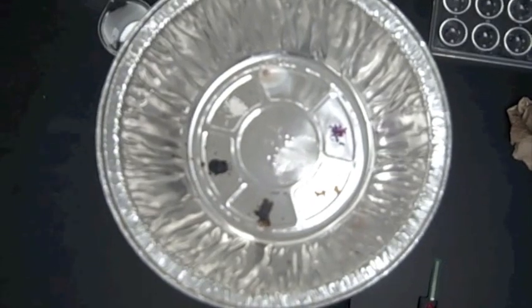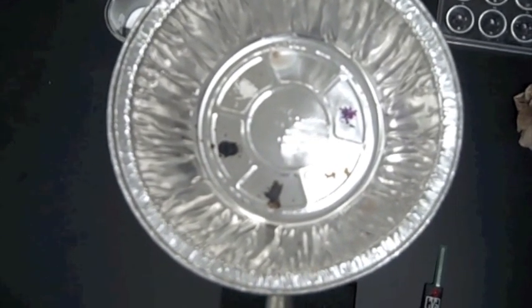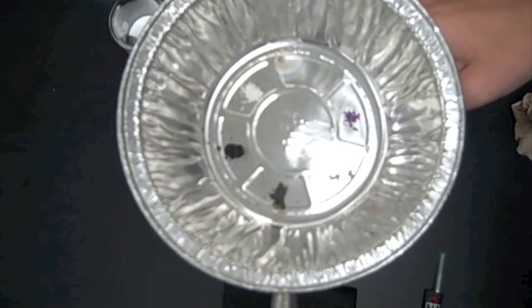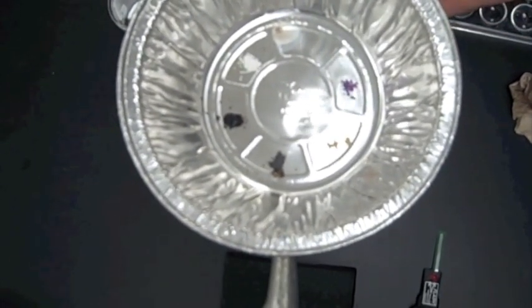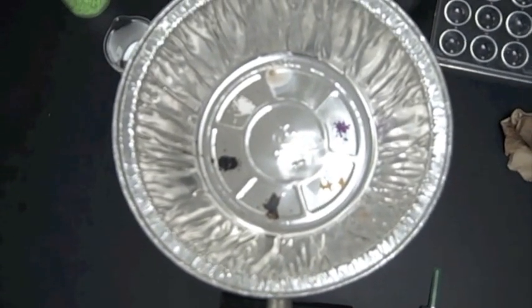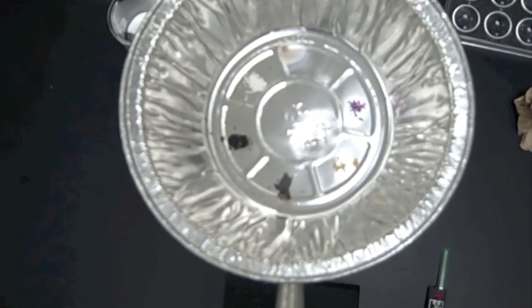And we could let this go on for a while if we wanted to. But it looks like the nickel chloride is kind of having somewhat of a reaction. But if you notice, we're starting to get a bubble in our plate and I don't want to ruin my pie plate. So we're going to go ahead and remove it from the heat. And we can make our data recording. We can turn the gas off at this point.